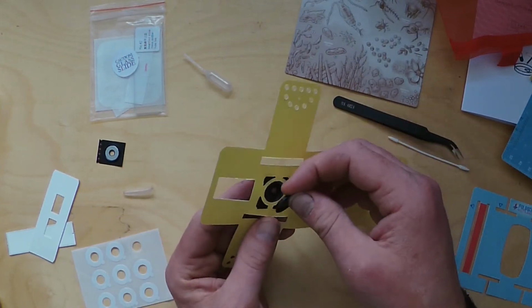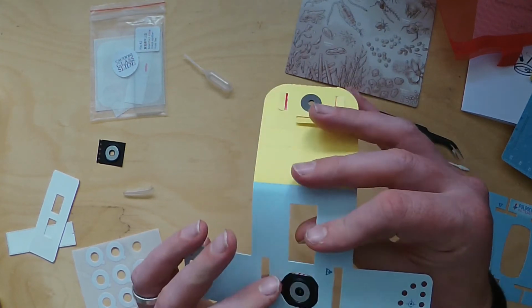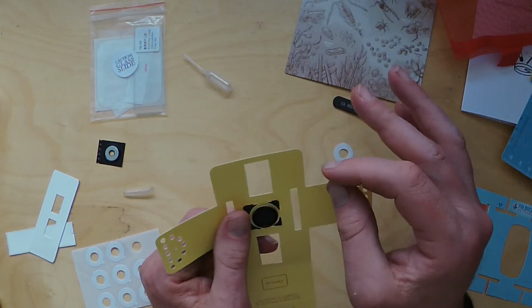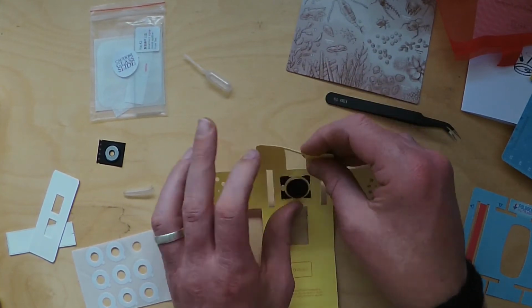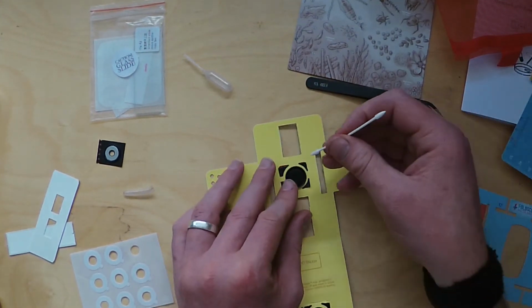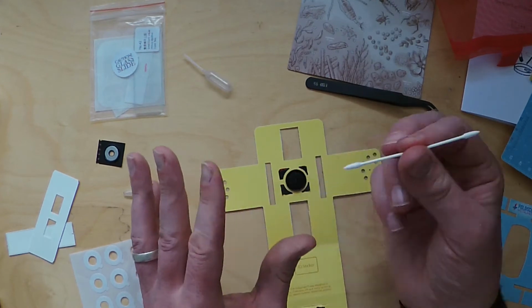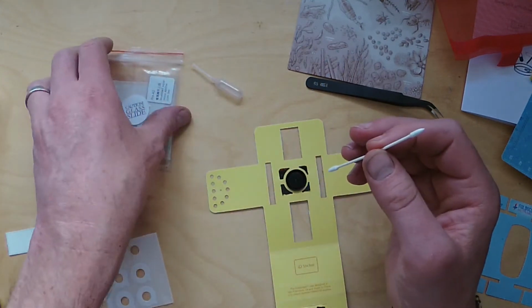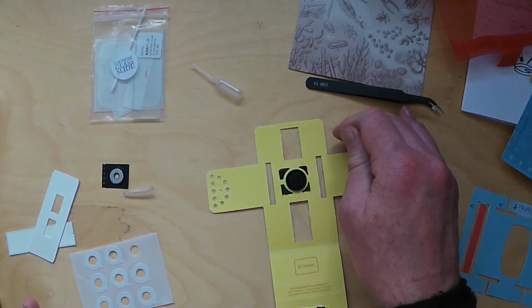That should go on there. Now the magnet should secure it, and make sure it goes in the right place, and the sticker just secures it and gives it an extra bit of stickiness so the other magnets don't pull it off. Now to keep that clean, you use your little Q-tip. Just give that lens a gentle little wipe, and you can always come back to that if you keep that somewhere safe and clean. Maybe back in the little plastic bag might be an idea. There we go. Okay, so that stage is done.